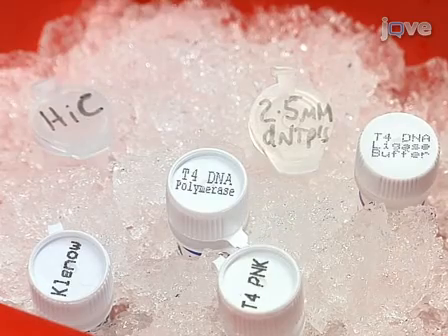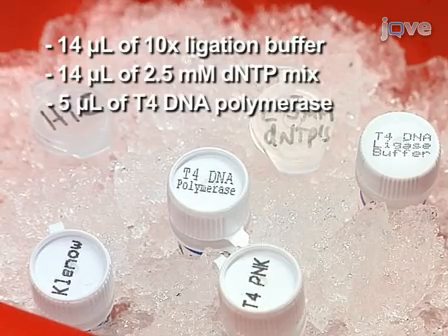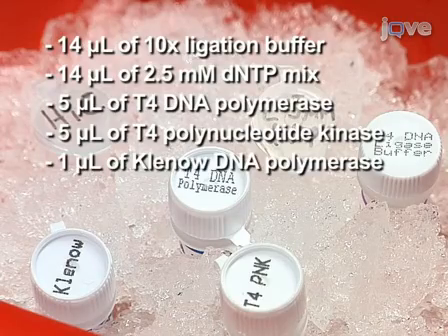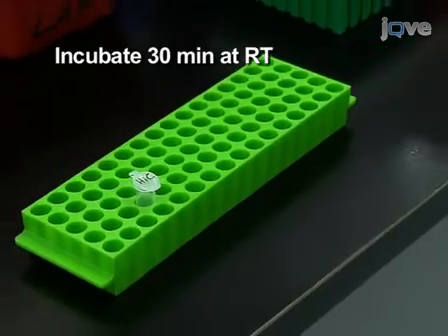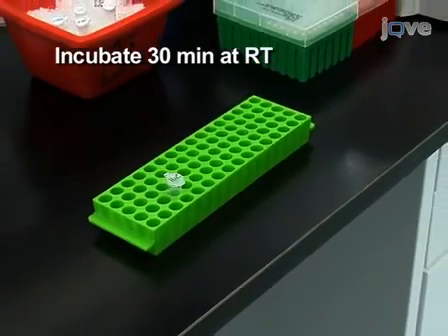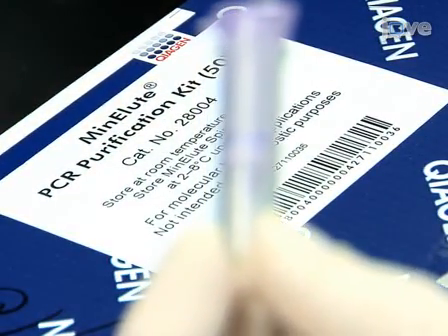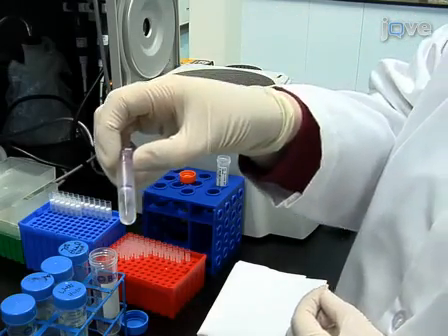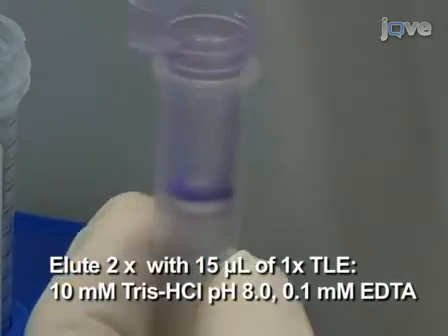The sheared DNA ends are repaired by adding 10x ligation buffer, dNTPs, T4 DNA polymerase, T4 polynucleotide kinase, Klenow DNA polymerase, and water. Incubate the samples for 30 minutes at room temperature. Following incubation, use a QIAGEN MinElute column to purify the DNA according to the manufacturer's recommendations. After loading the DNA on the column and washing the column, elute the DNA with 15 microliters of 1x TLE buffer twice.